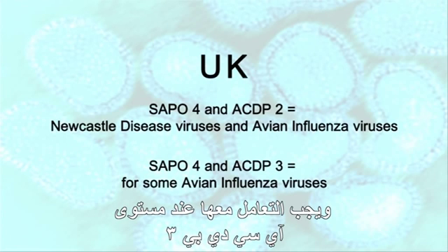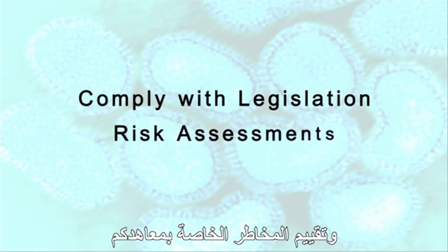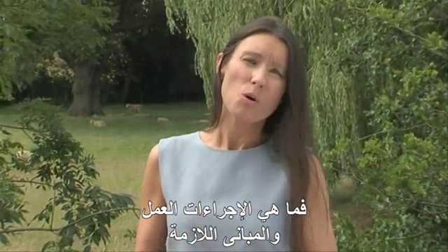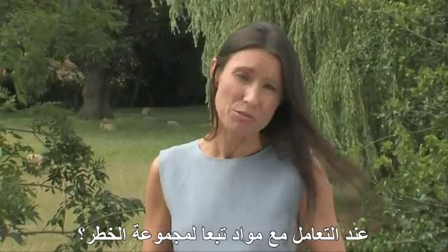It's recommended that these should be worked with at ACDP level 3. Remember, you must comply with your country's legislation and your institute's risk assessments when working with any avian influenza or Newcastle disease viruses. So, what are the procedures, working practices and facilities required when handling materials in each of the risk groups?